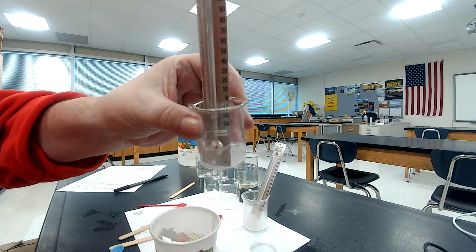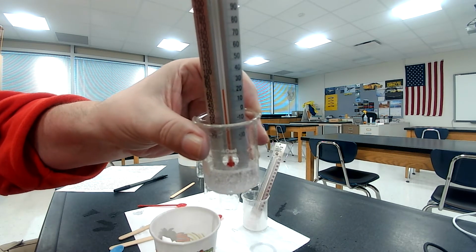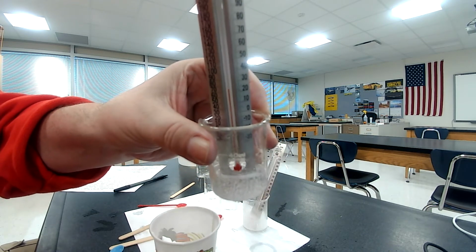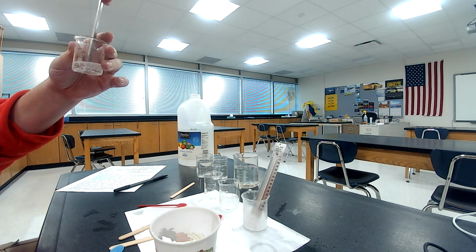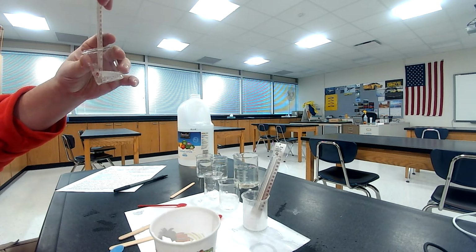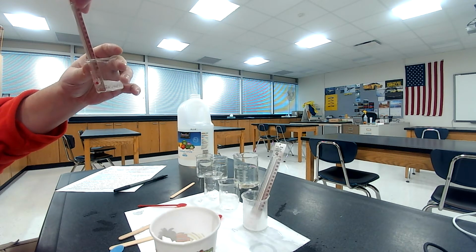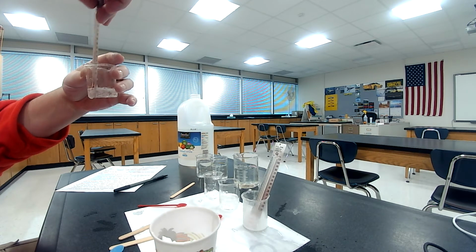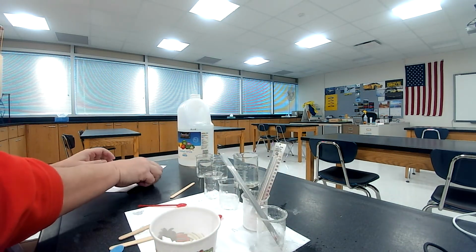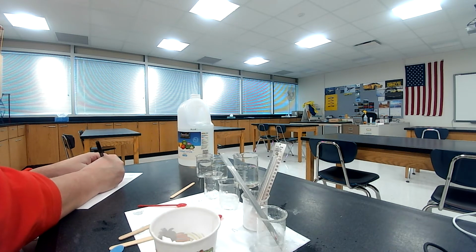And you can see here, I know it's hard to see with this. Okay. All right. Ooh, it went up. Okay, I'm reading 24 degrees Celsius. 24 degrees Celsius. So you're going to record that in the final temperature.